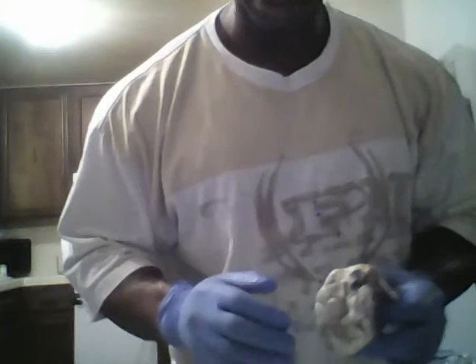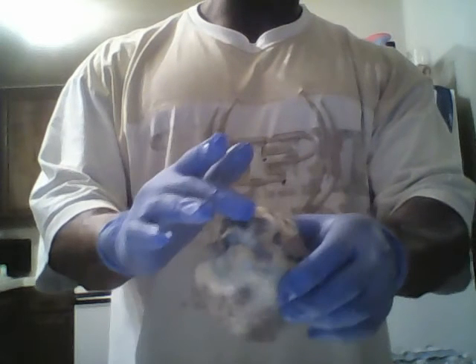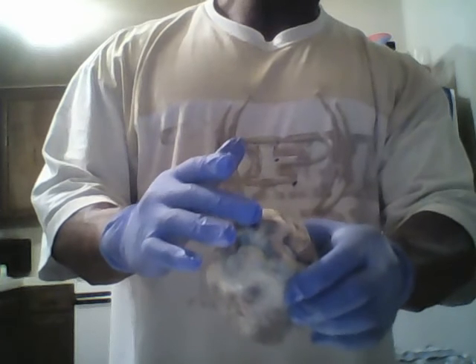I'm continuing with the anatomy of the sheep heart. Last time I left off with the external anatomy of the sheep heart. Now I'll be discussing the internal anatomy of the sheep heart. So here again is my sheep heart. I had mentioned the apex and the base. I talked about the aorta. I discussed the pulmonary trunk and brachiocephalic artery.